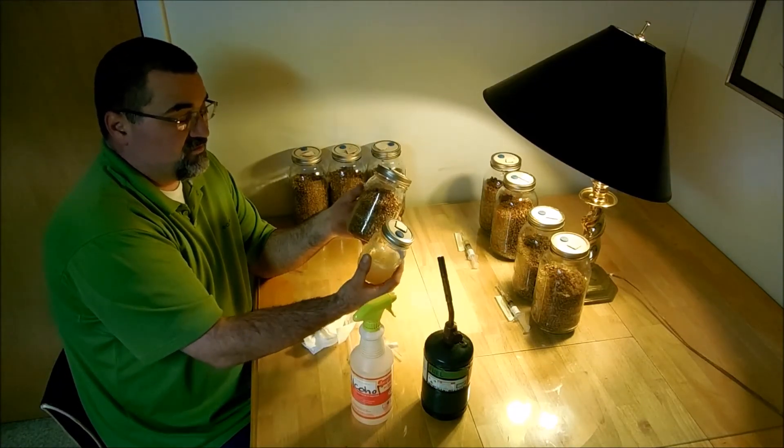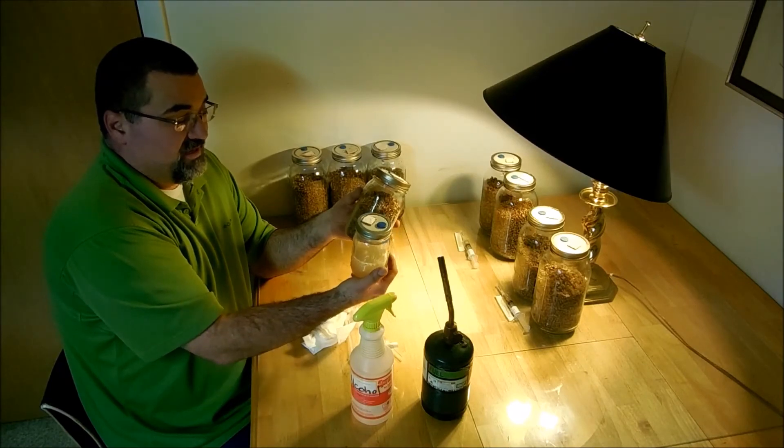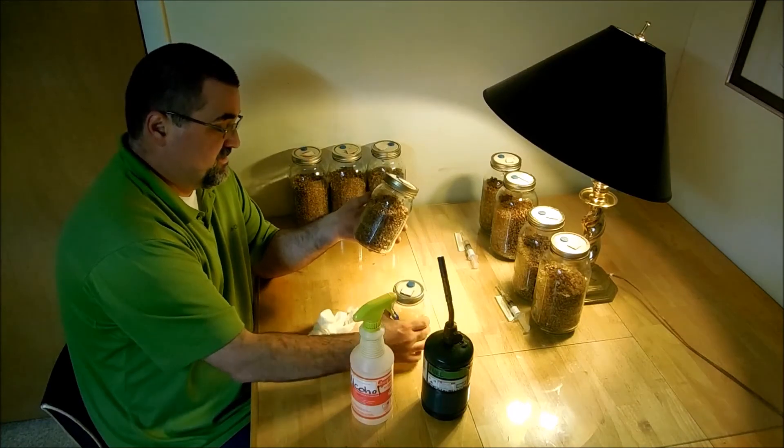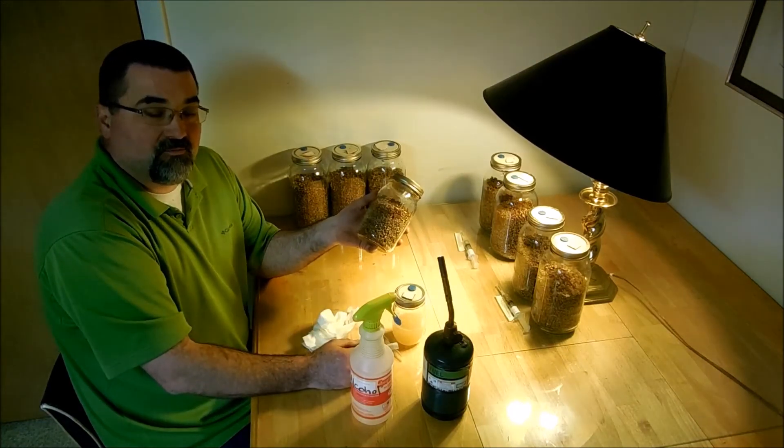And if the mushrooms are good, then I will use this culture from here on out. And this is a lion's mane, so I actually won't put it on straw. I'll put it on wood.